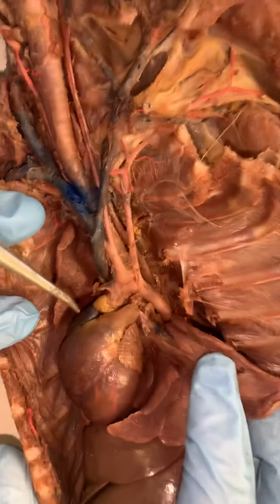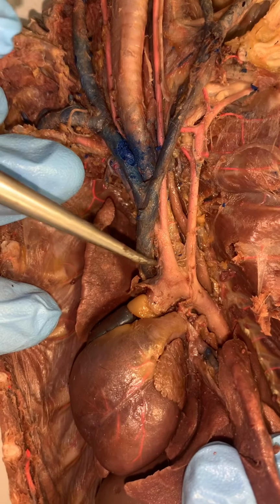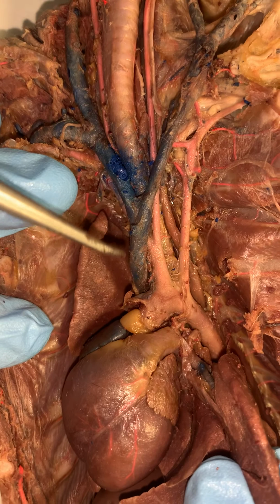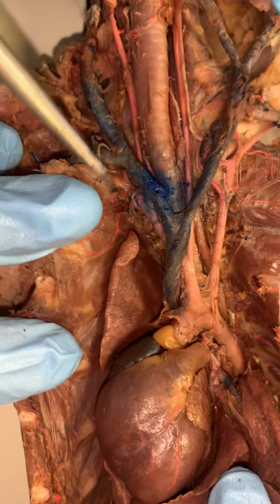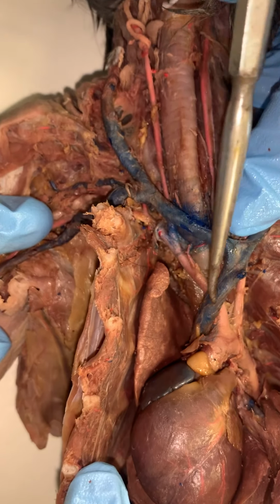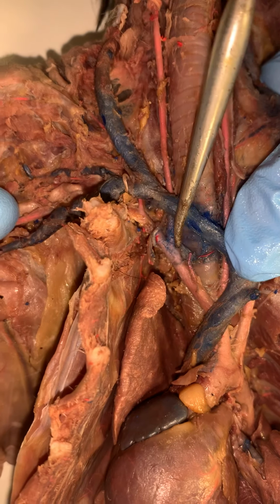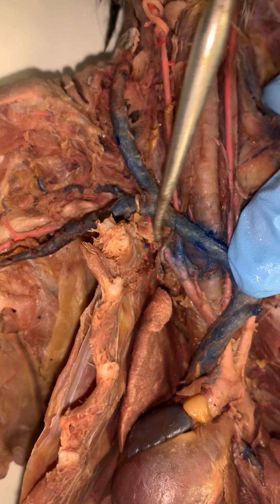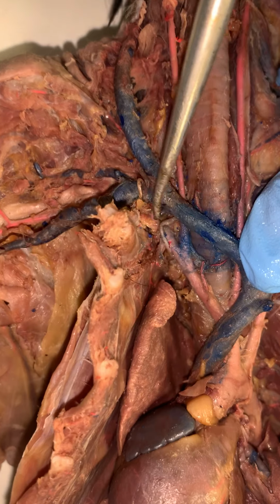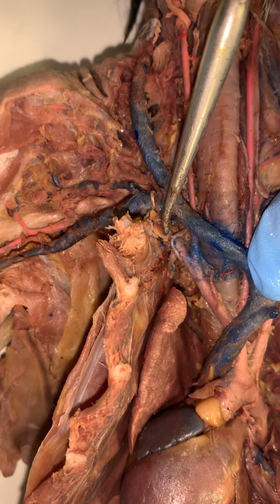Coming off of this arch, right here, is the brachiocephalic artery that you can see right here. And we're going to go ahead and work on the right-hand side. Now we need to move this vein out of the way, but this is still all the brachiocephalic. And then right here, you'll notice that we get a split or a bifurcation. This first split that you can see right here is called the subclavian. And again, it's not very long. It's just this little piece right here.